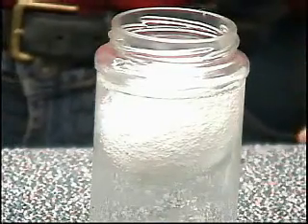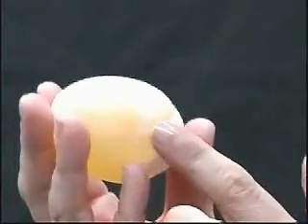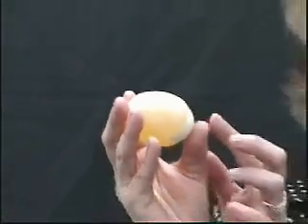Dr. Pope showed you how to process the egg so that the shell will be dissolved, and this you should do with two eggs simultaneously. It will take a total of about three days for the shell to fully dissolve, and then what you will get is an egg similar to this one, where most of the shell has been dissolved. You can see in this egg the shell has mostly been dissolved except for at the two ends, which makes it easy to handle.